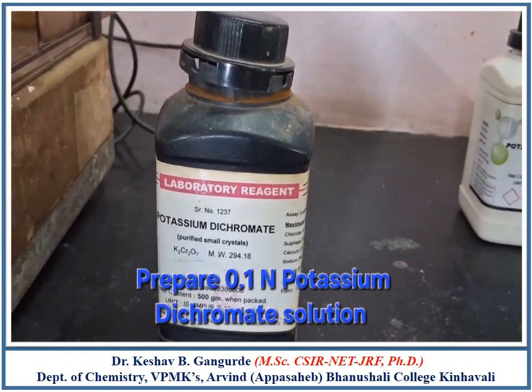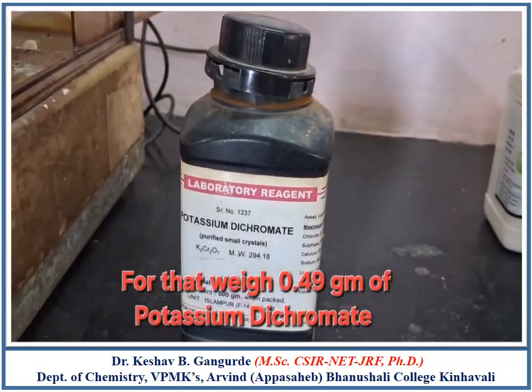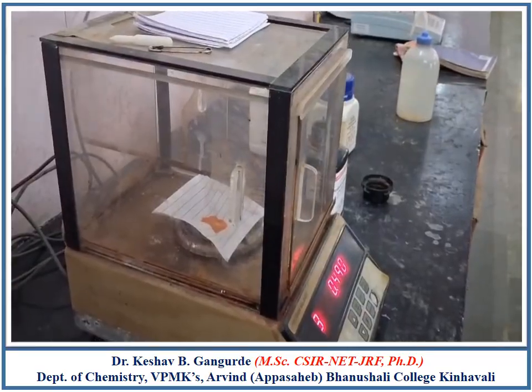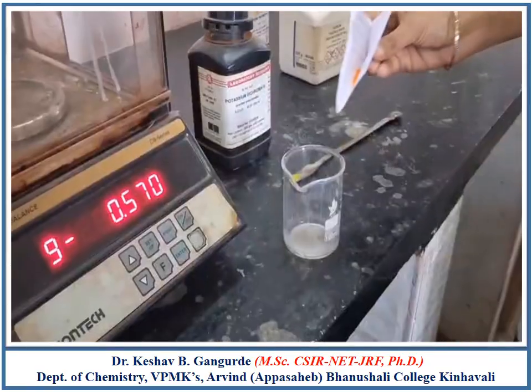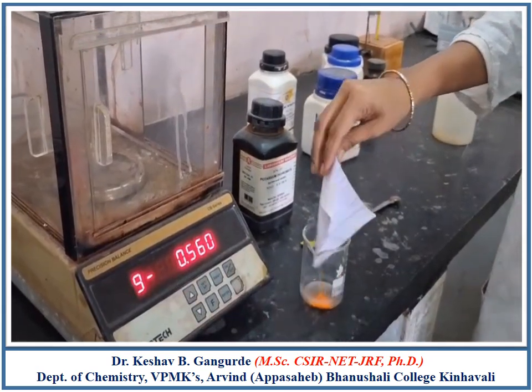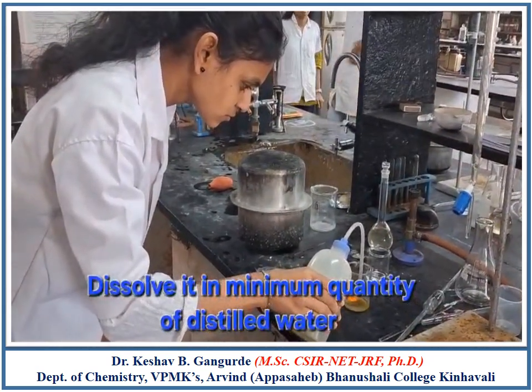Now weigh 0.49 gram of potassium dichromate to prepare 0.1 normal potassium dichromate solution. Transfer the weighed quantity in the beaker. Dissolve it in minimum quantity of distilled water.